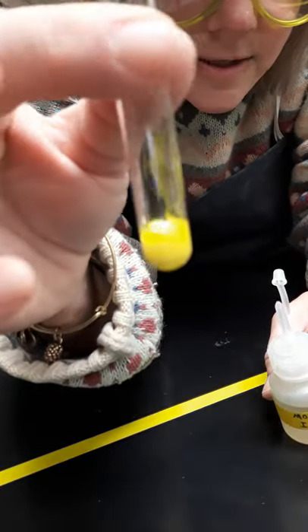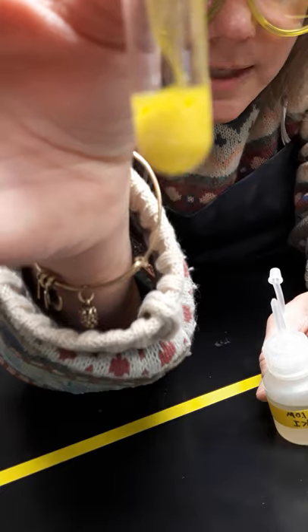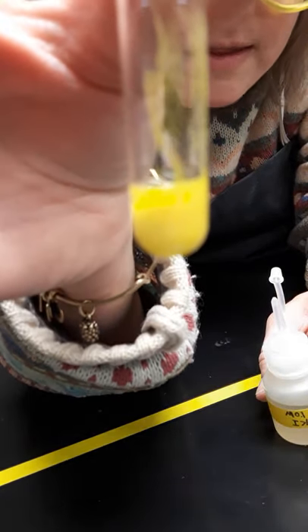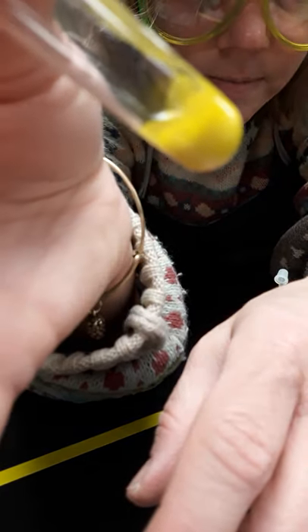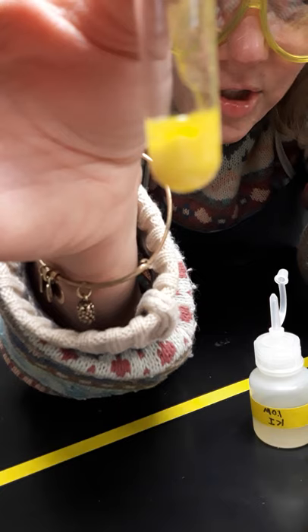And there is your result. I just want you to really take a look at what's going on there. You can kind of see that you have some liquid towards the top level of the fluid, and then you have a little bit of a solid at the bottom. That's reaction number three.